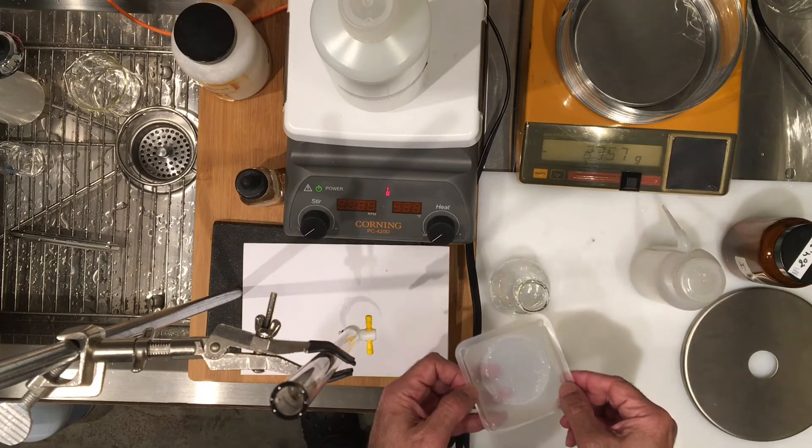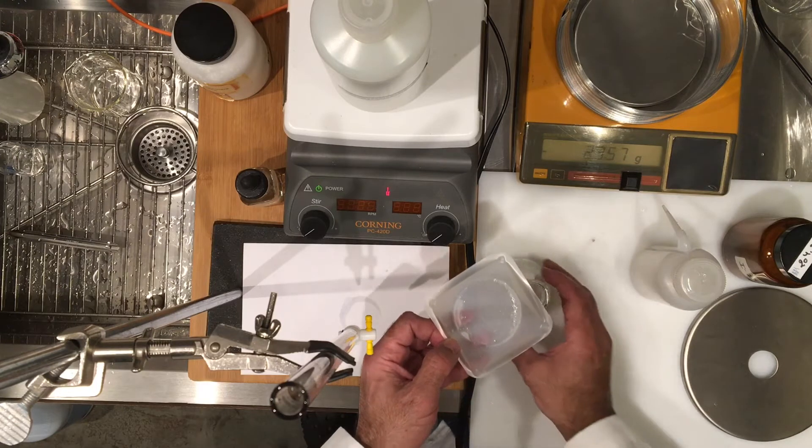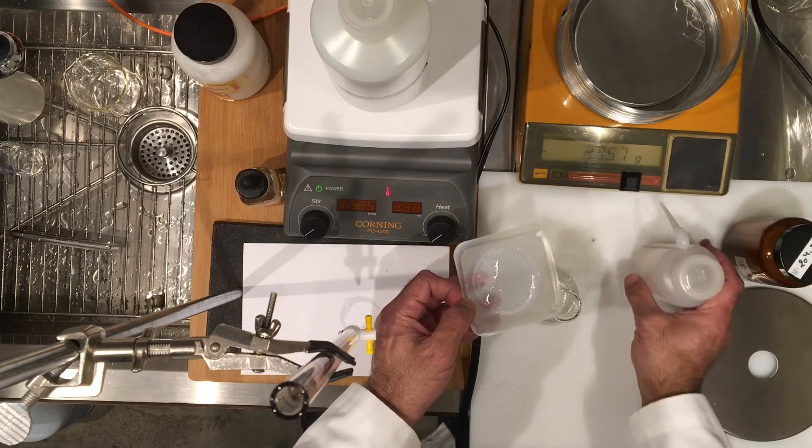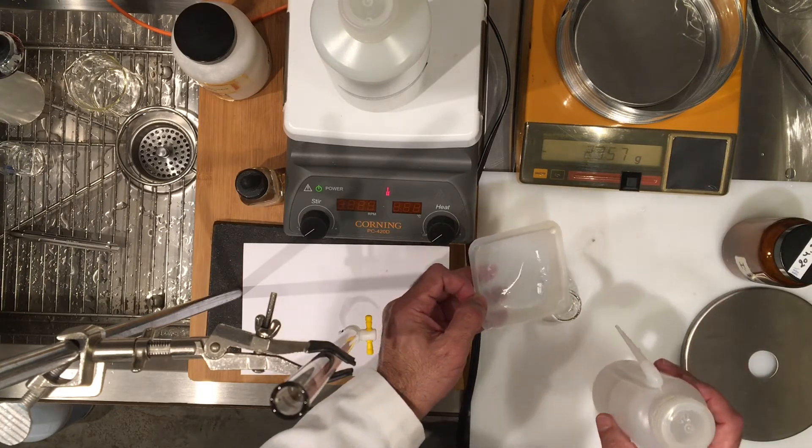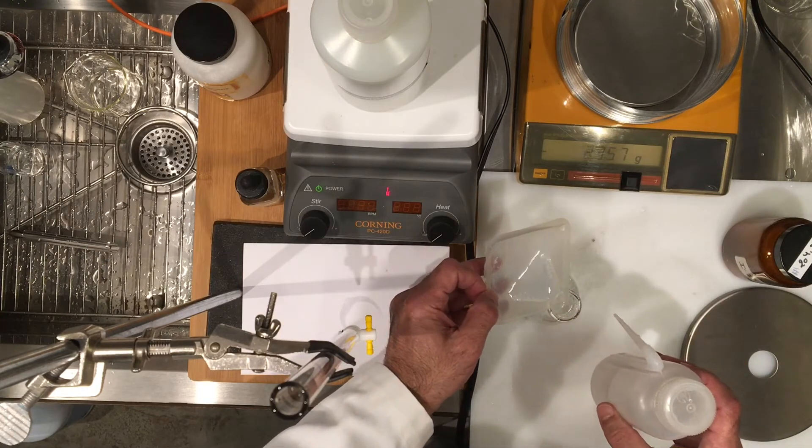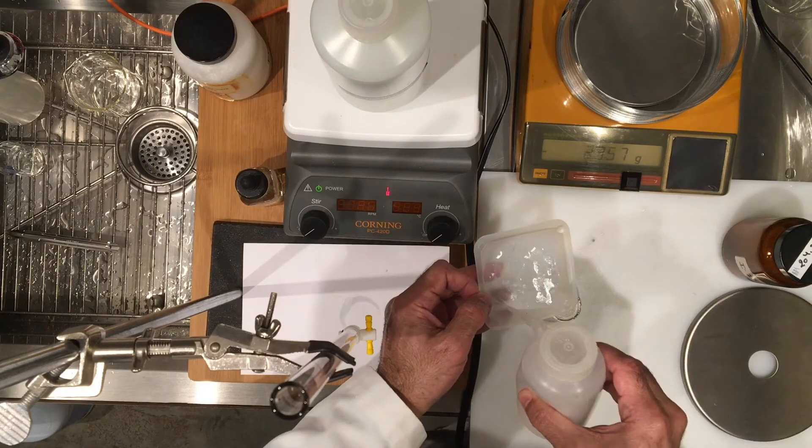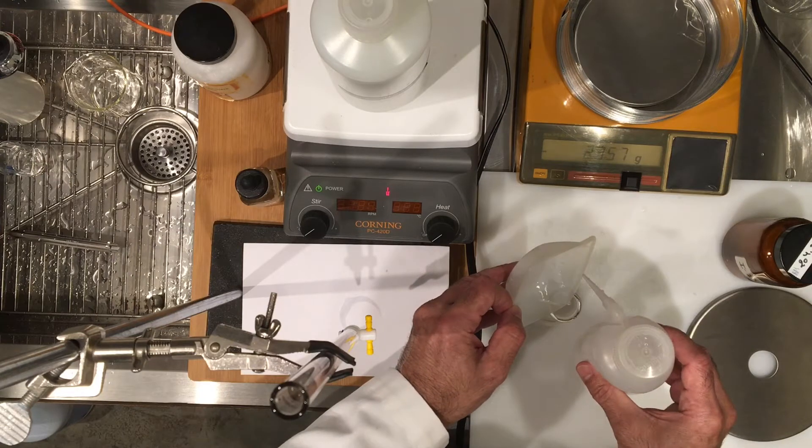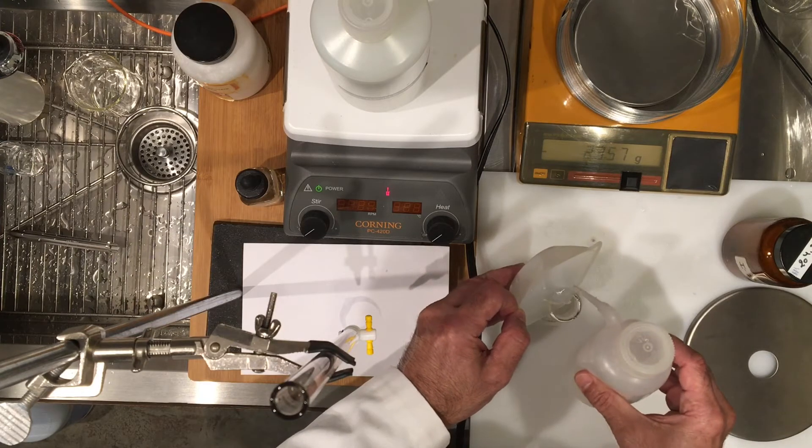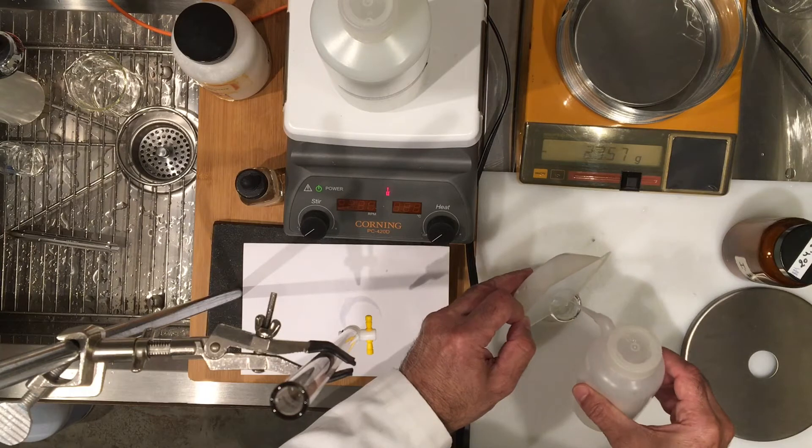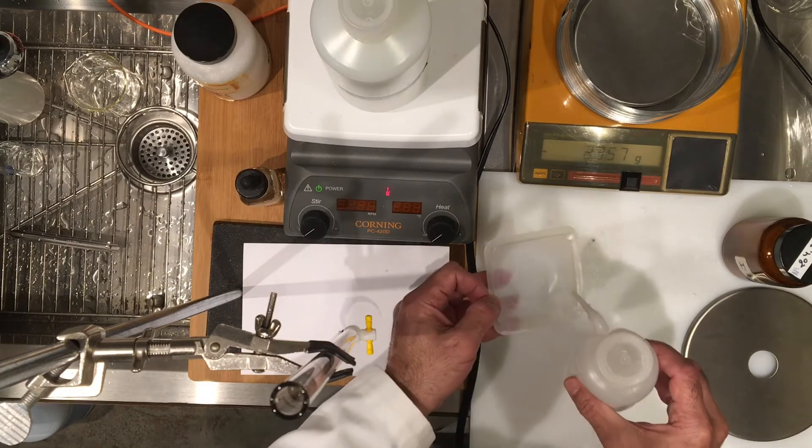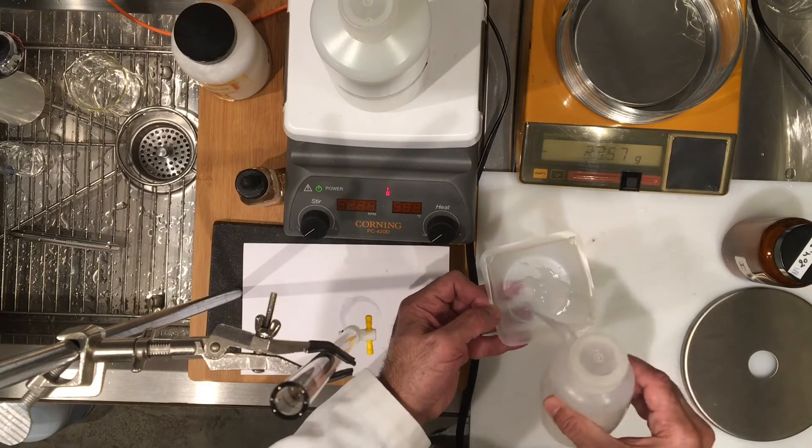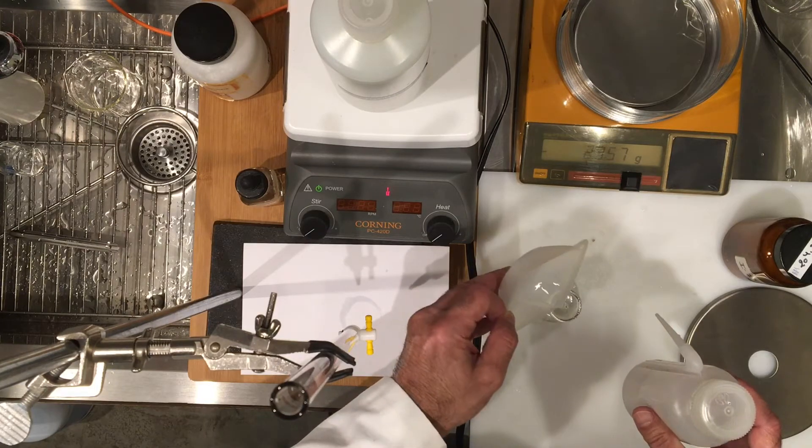The quantity of water doesn't really matter because you're going to be titrating on a mole basis and this is a complete reaction. So I'm going to show you how I transfer. I'm going to go ahead and wash this. I'd like to rinse it a few times with water. Again, as I said, quantity of water doesn't matter.